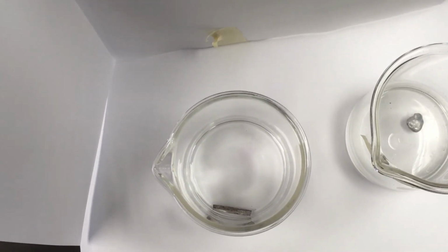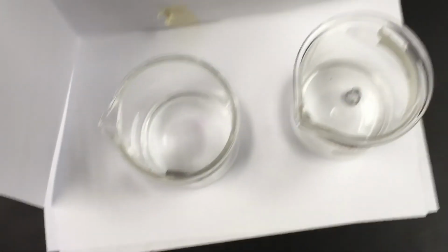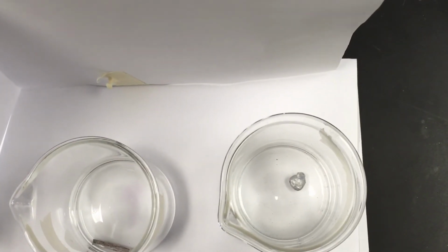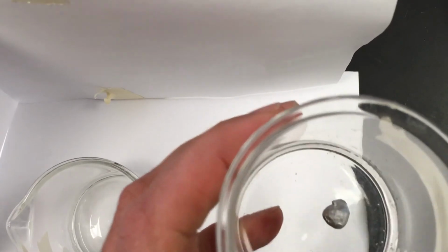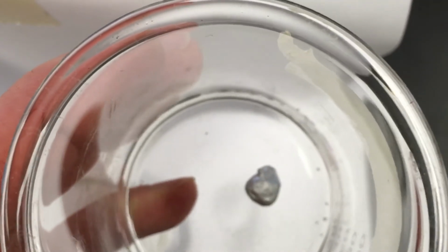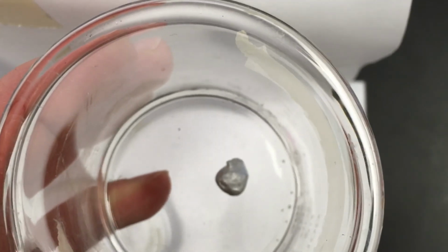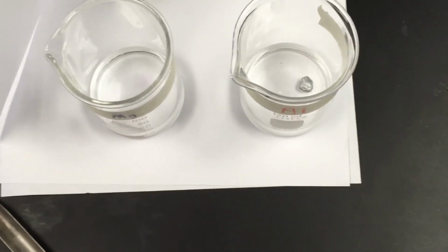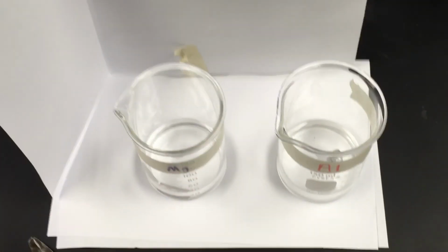So go ahead, you can take a photo of that. That's magnesium. And then look at aluminum. It's hard to tell, nothing's really happening. Let's hold it up here a little bit. I might see just a tiny little bit of bubble. So we need to test further. It's hard to see which is more reactive. We think magnesium is the winner right now. We can't be sure. So that brings us to part 2.